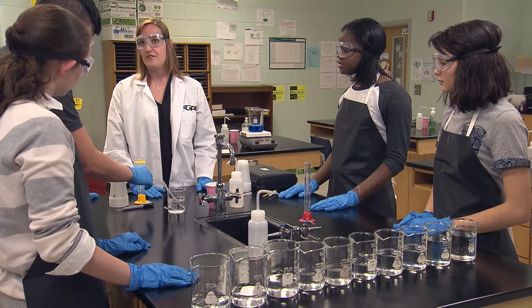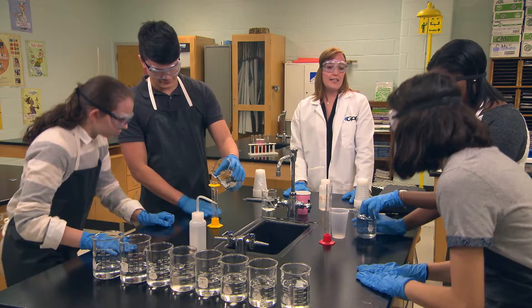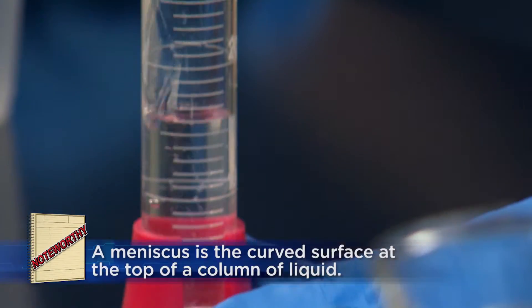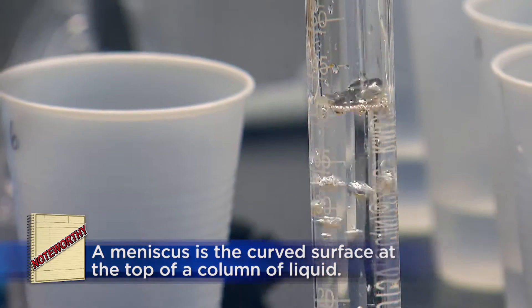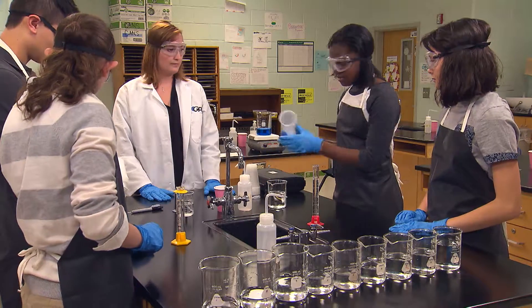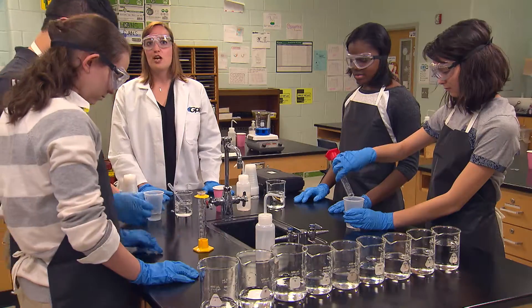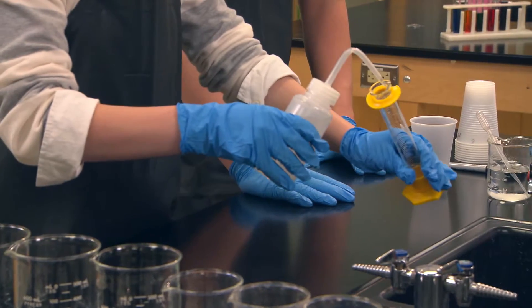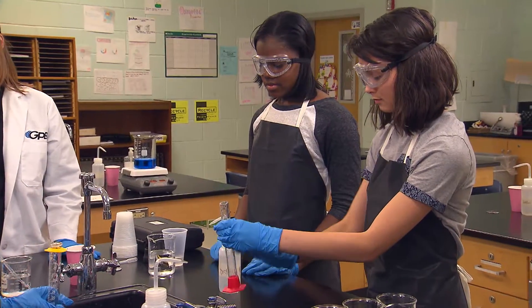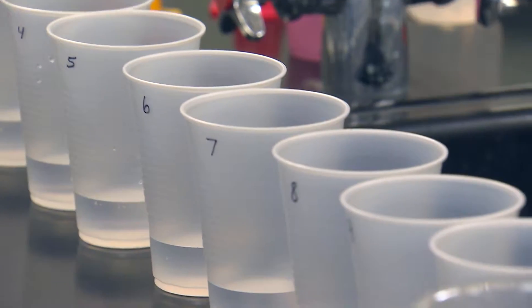Use your graduated cylinder to measure 50 milliliters of water from your first sample. Pour water carefully until the meniscus on top of the water sample matches the 50 milliliter mark in the graduated cylinder. Then pour the sample into the labeled container. Carefully wash the graduated cylinder with distilled water between measuring the volume of each sample. Then add 50 milliliters of each water sample into the correct cup. When you've finished this part of the procedure, you'll have ten different river water samples in ten different containers.